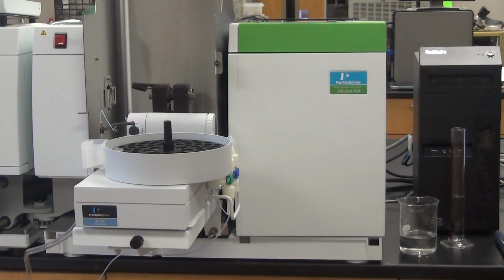Then you go here, check method, it says both auto sample location and a volume must be defined for each. Because I haven't hit anything. Standard 1, standard 2, auto sample. I don't have it deleted. I don't see where the problem is. It's telling me both an auto sample location and a volume must be defined on the calibration page for each. Oh, yeah, there we go.